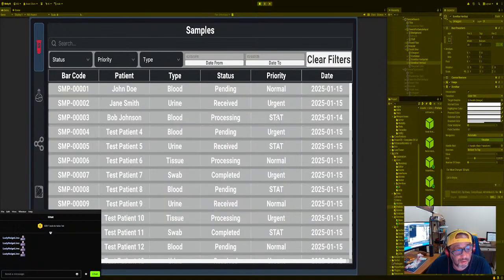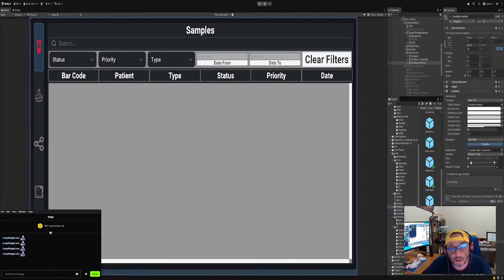So now what we need to do is, we could either build out the filter, I mean the system sample type, or we could just add functionality to it. I wanted to add functionality to the actual sample row, right? I just want to make sure this is the sample row. This is what we're using.